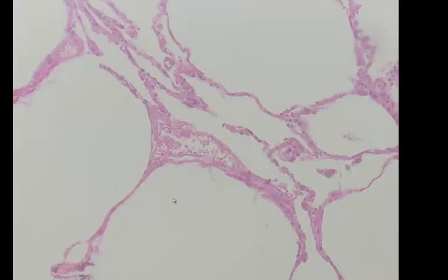We want oxygen to easily diffuse across here. This is called the respiratory membrane. Here's a little simple squamous cell, a simple squamous cell that's lining this capillary. So oxygen can easily diffuse across this respiratory membrane into this blood vessel, and then oxygen can be distributed throughout your body to the tissues.